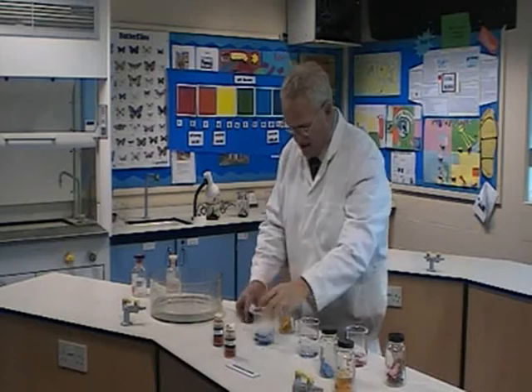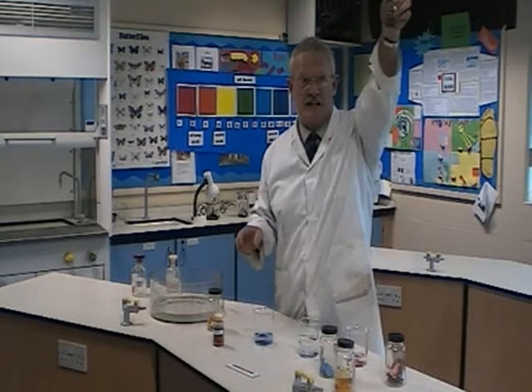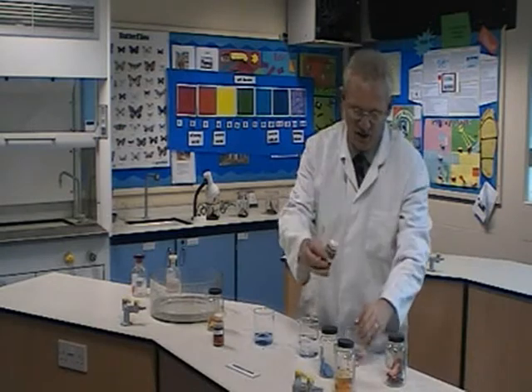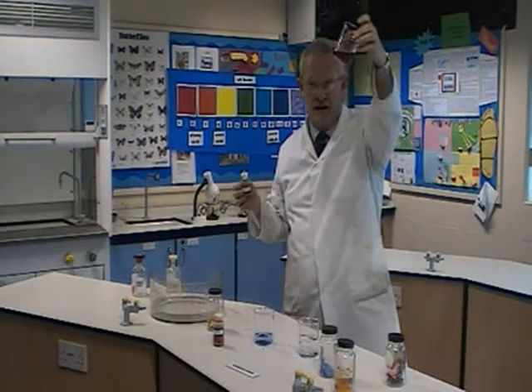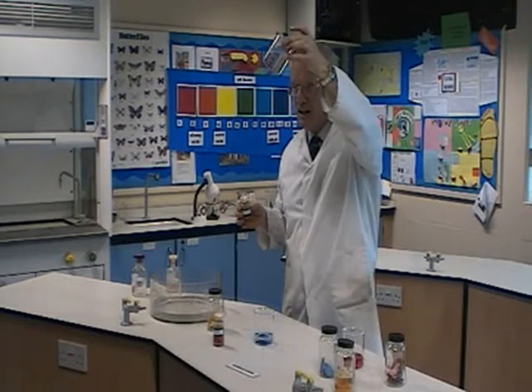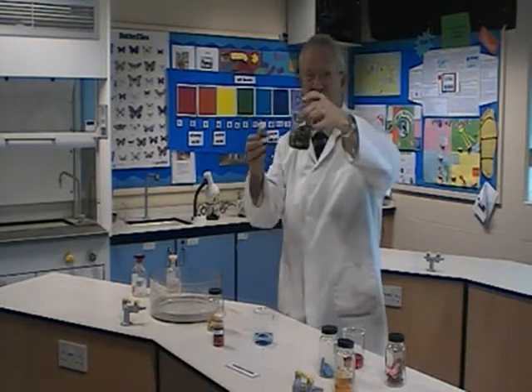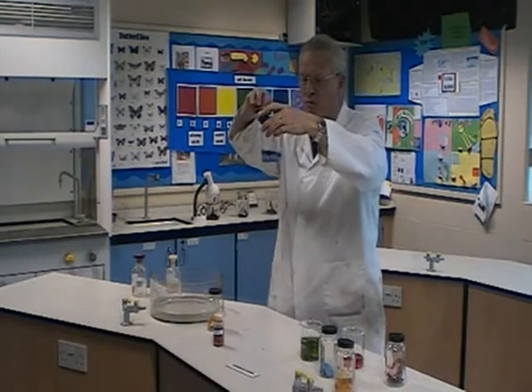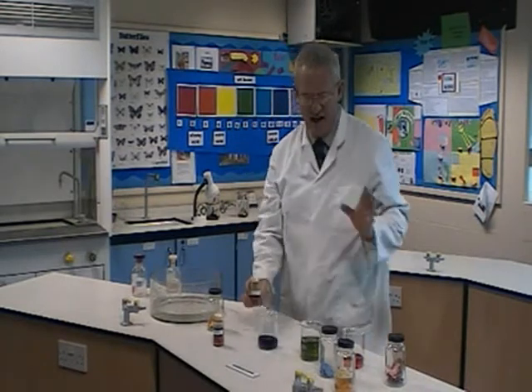Now I can also use my universal indicator solution. Pop it in the acid — lovely red. Pop it in the water — that should go green, and it has indeed. Pop it in the alkali — which will go blue-purple. I usually refer to it as blue; it's easier that way.